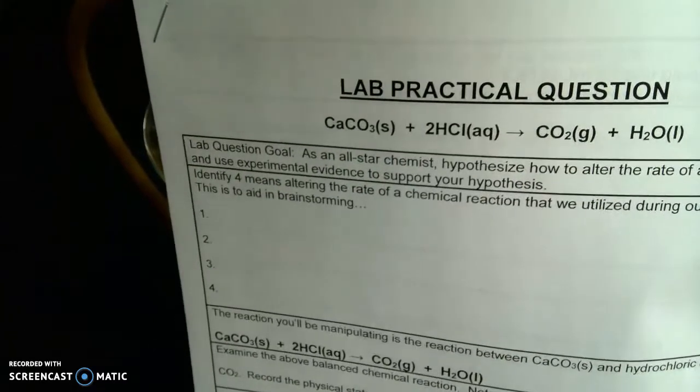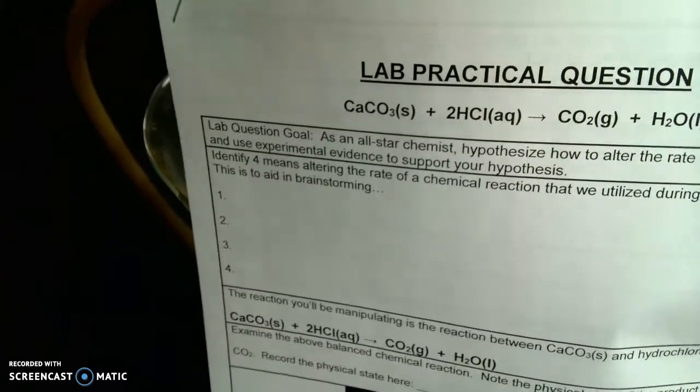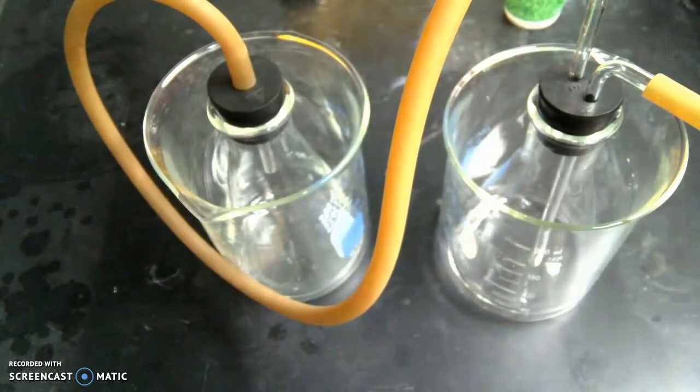Okay, this is the instructions for the lab practical question that we'll be performing this week.